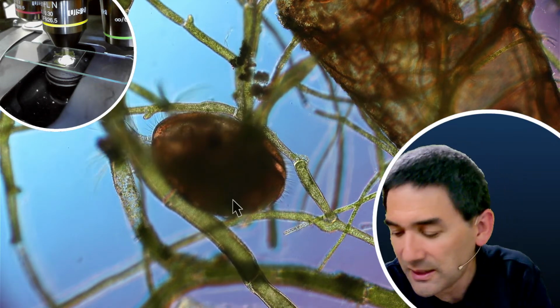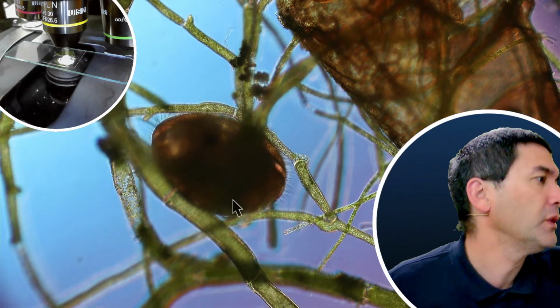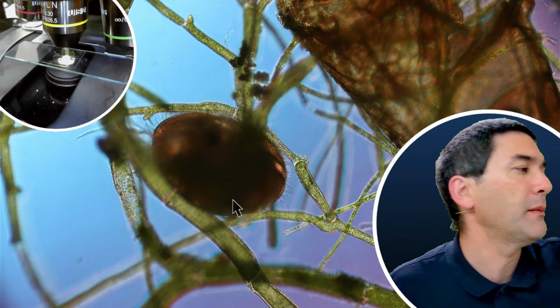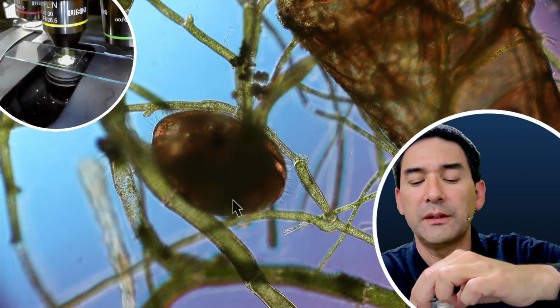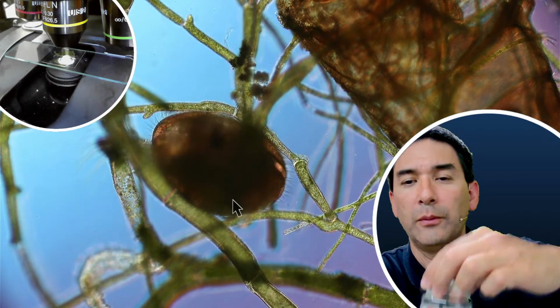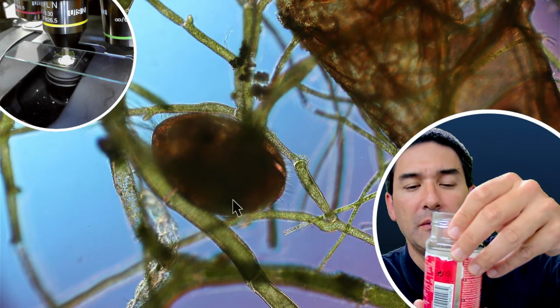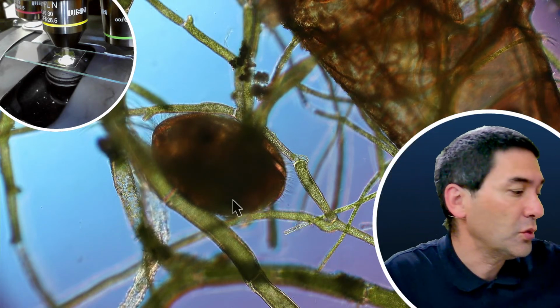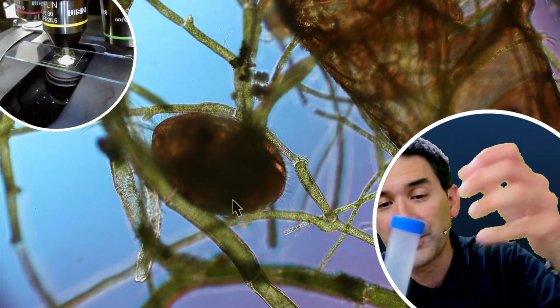Then the sample also doesn't look very nice. For example, we can actually observe this as well. Last time I also showed it to you. This jar here, I collected some algae and some water from the Baltic Sea, and I took it along in those plastic containers. I had to close them, of course, because otherwise I could not transport them.